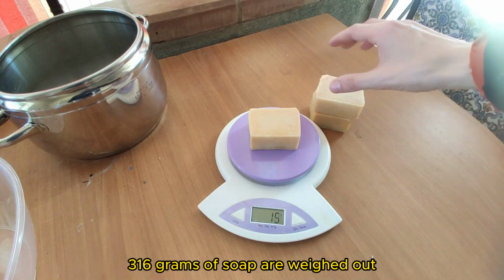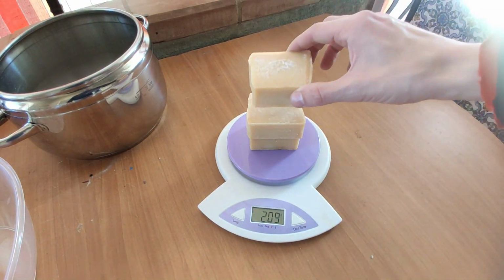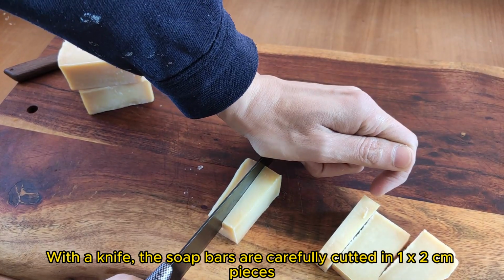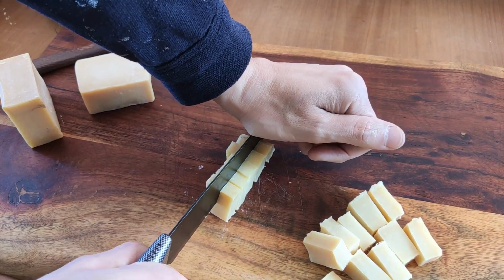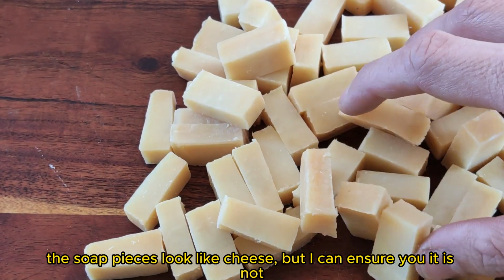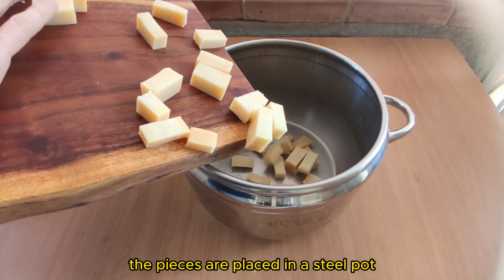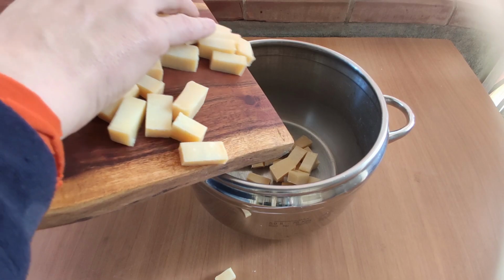316 grams of soap are weighed out. With a knife, the soap bars are carefully cut into 1 by 2 centimeter pieces. The soap pieces look like cheese, but I can assure you it is not. The pieces are placed in a steel pot.